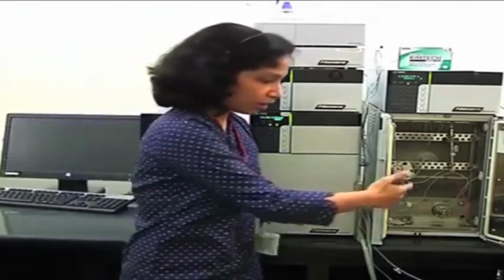Okay. There are different types of mixer available: 20 microliter, 40 microliter, 180 microliter. So depending upon your requirement, you can select which mixer is good for your analysis. Of course, the higher the volume, the better will be the mixing, but it increases the system volume, so your peaks will come slightly late. So you will have to strike a balance whether you want to finish your analysis very fast or want better mixing. Depending upon that, you will be selecting your mixer.